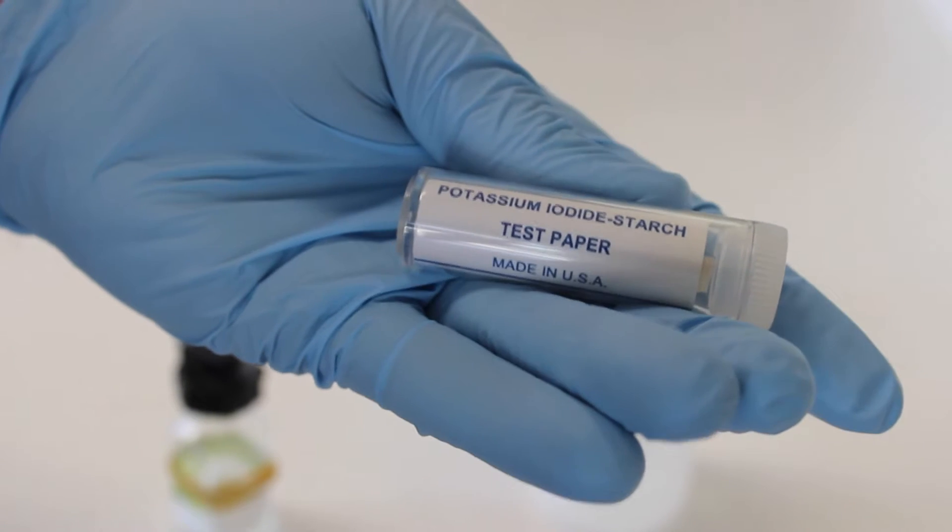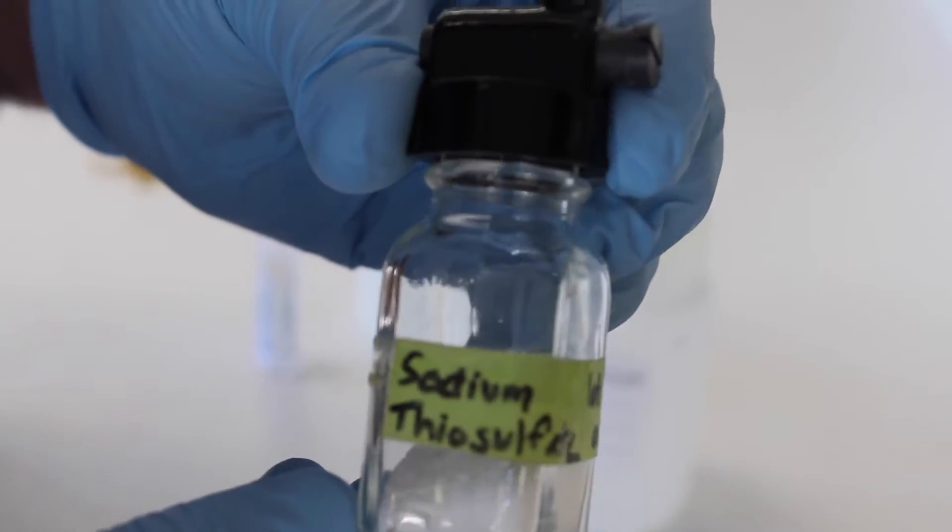You will need potassium iodide starch test paper for this procedure, as well as sodium thiosulfate for dechlorination.